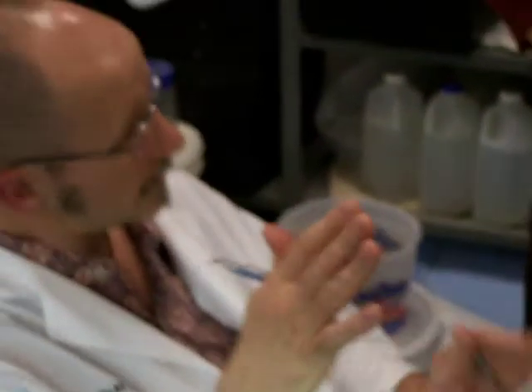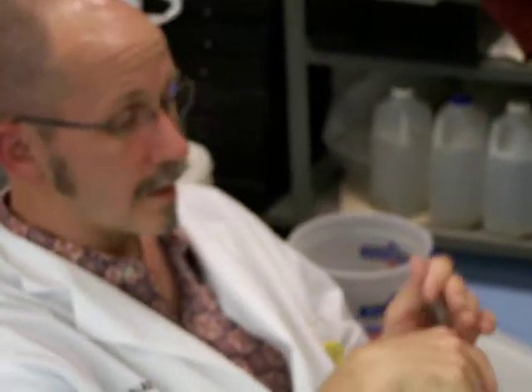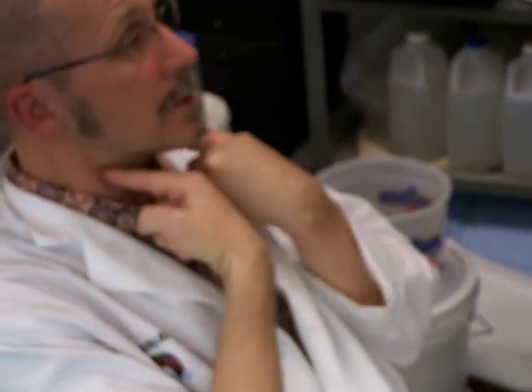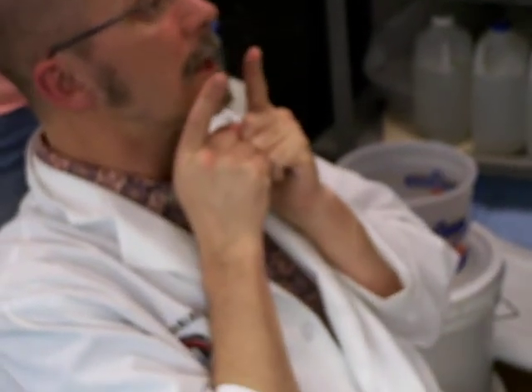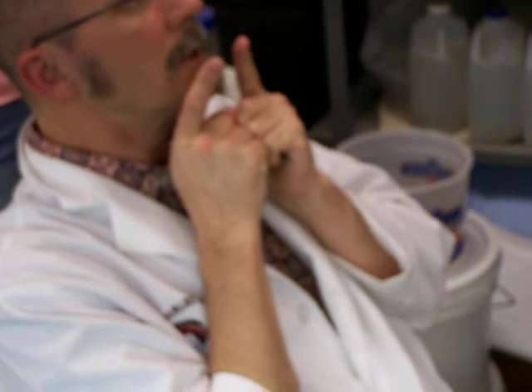I mean, you can identify what they are, because on those you're going to have thyroid going medially. You're going to have the occipital going straight back toward the base of the skull, due dorsal. You're going to have the ascending pharyngeal going up at an angle around the pharynx. You're going to have the internal carotid going just medial to the bulla, if you can see it.